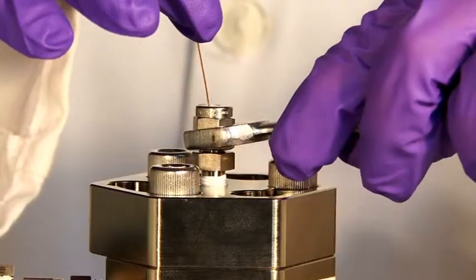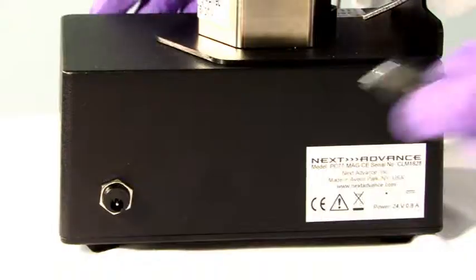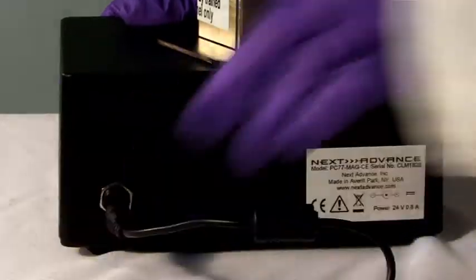If you are using the integrated stir plate on the PC77 MAG, make sure that it is plugged in before using. You are almost ready to go.